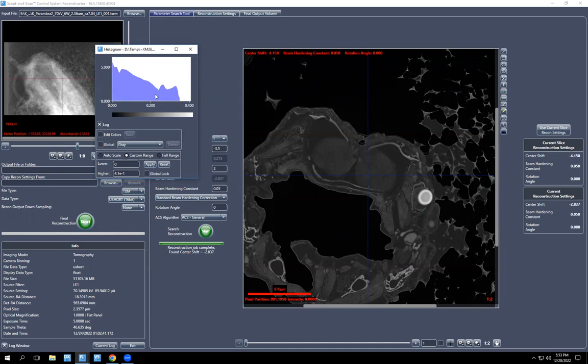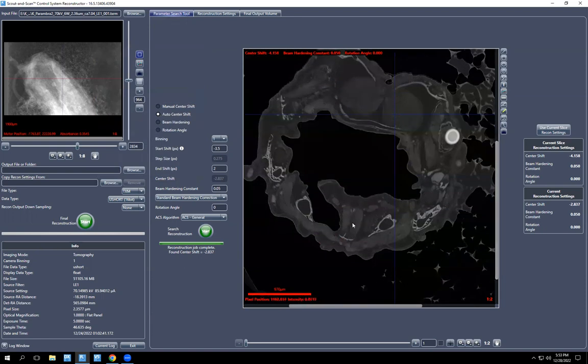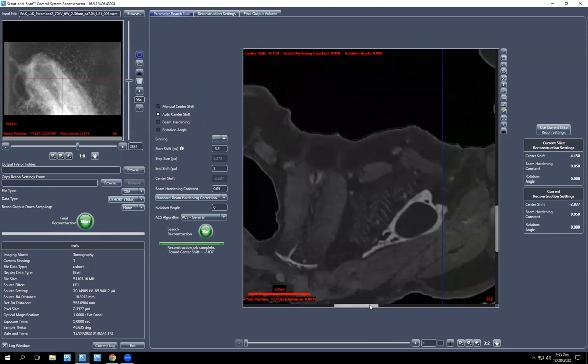You can click log to see what your data looks like. And we already checked the first segment in Dragonfly and it looked fine. So we're going to keep those numbers. Right, so focus in on some structure here.